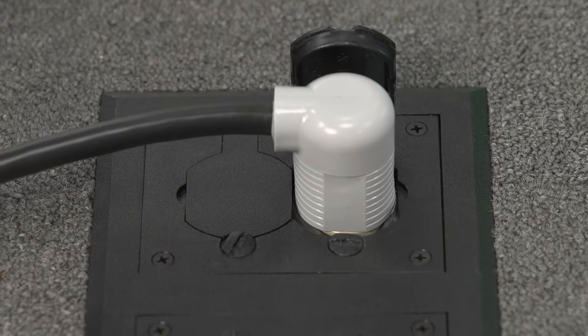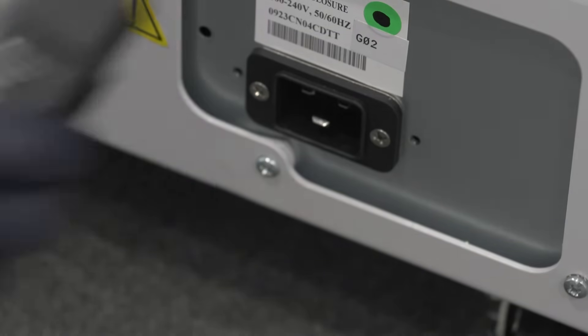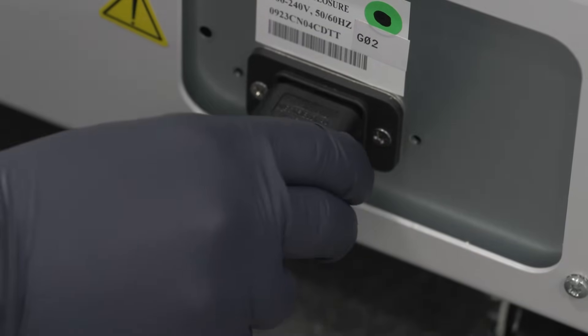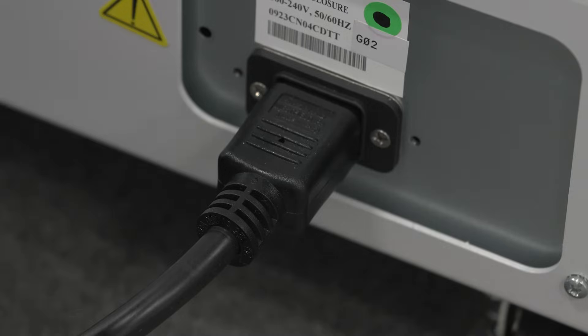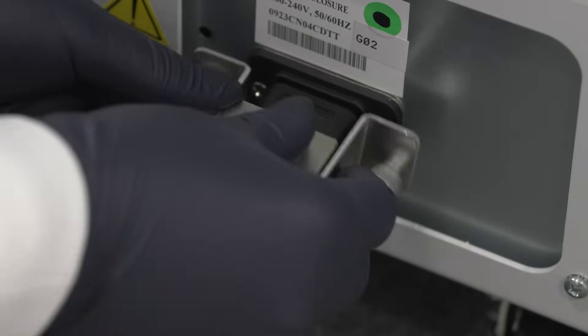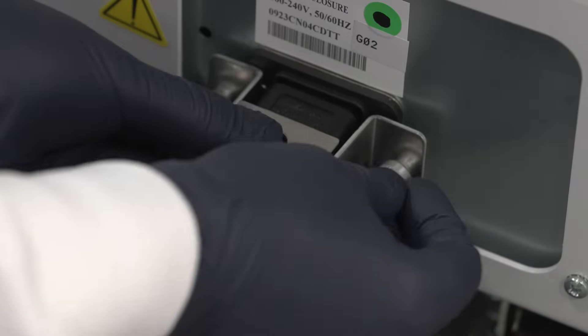All you need is the appropriate power cord and plug to match your region or electrical setup. Once you have selected the appropriate power cord for your installation, plug the rectangular end into the receiving port at the back of the freezer.